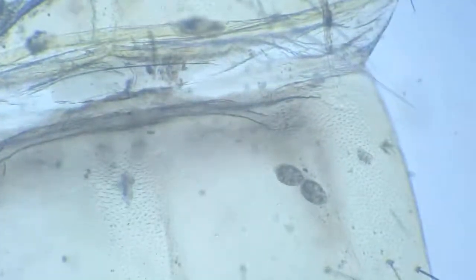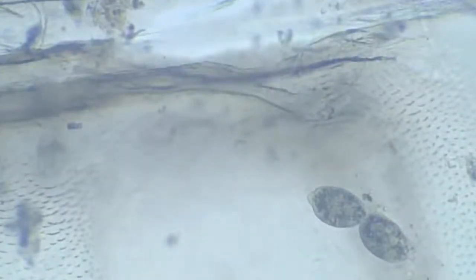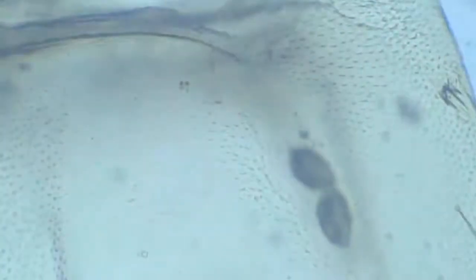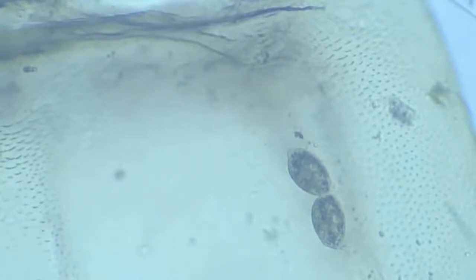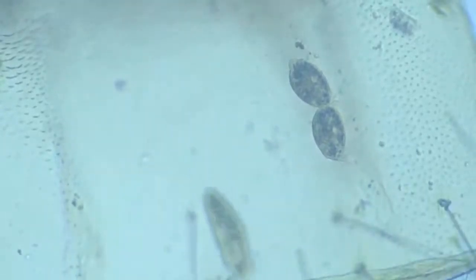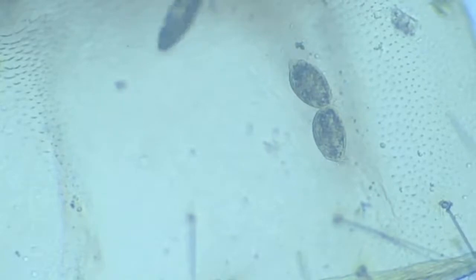These are the cuticle remains of what once was an adult mosquito. Now we go back to the reproducing unit — the lovebirds we have here in this apartment. They are still in the process of conjugation, and if you remember from the previous stage, they have separated slightly more now. They have separated more than what we previously saw and are not far from being two individuals.